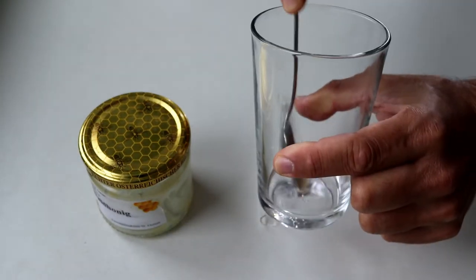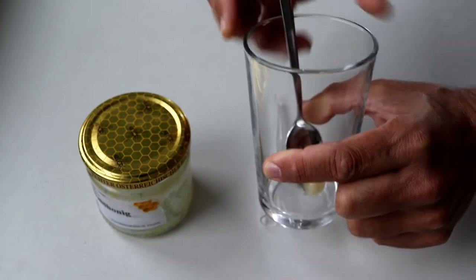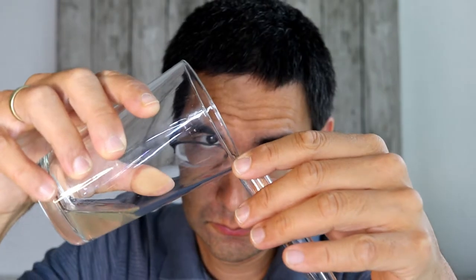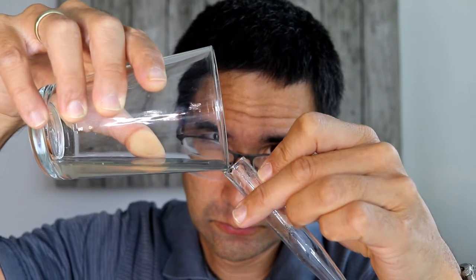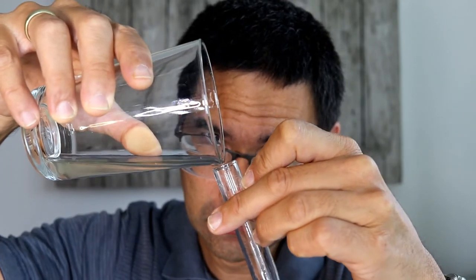Of course, this will dissolve the sugar and set the pollen free. And this takes a couple of minutes and when everything's properly dissolved, I'm pouring the solution back into the tube.